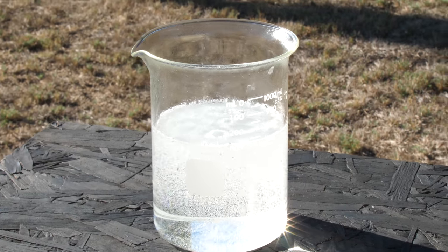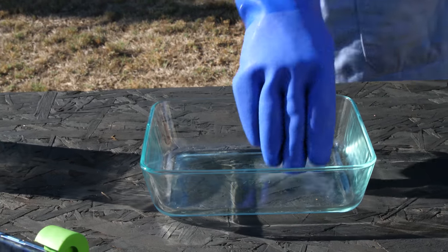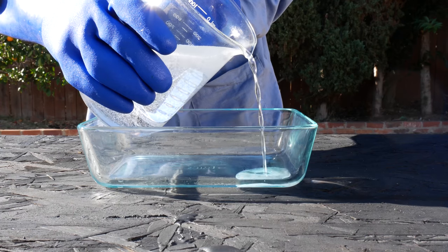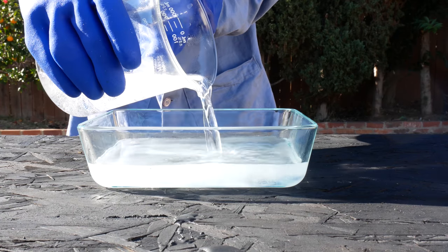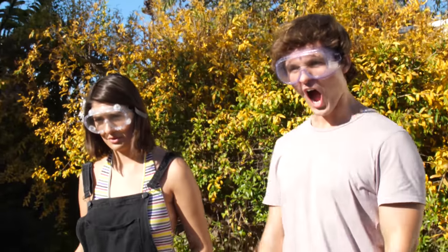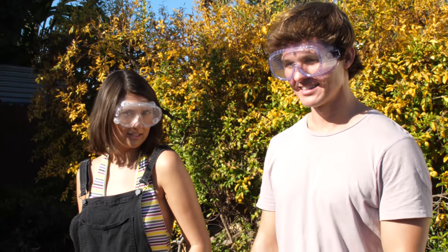What I'm going to do is pour this in here — not a ton — and then just go ahead and drop our little Christmas present in there. It's gooey and bubbly. It looks like club soda, but I feel like it doesn't taste like club soda.